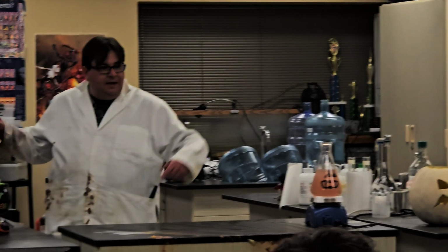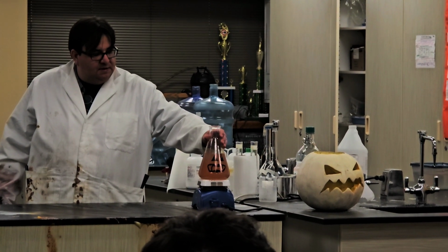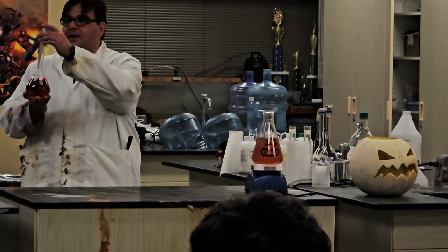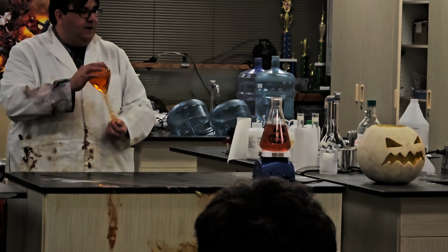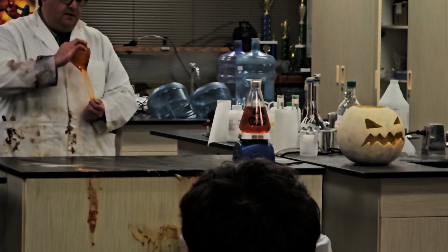It will end up changing this color and then be colorless, and it'll just keep cycling through that, so you can watch it. Here I have another little pumpkin that we can change colors back and forth. But this one we can watch going from adolescence to becoming a jack-o'-lantern.